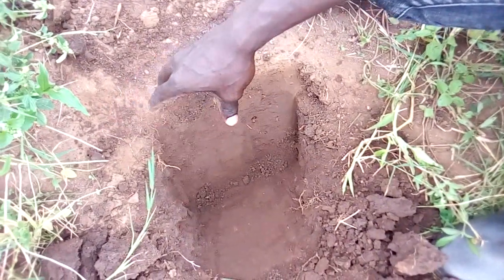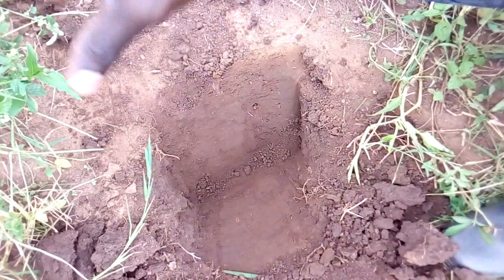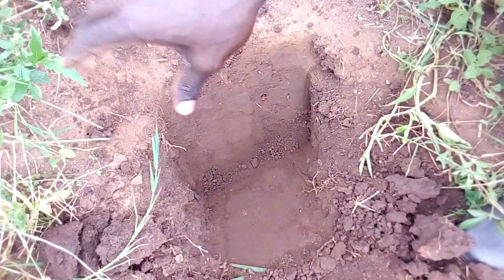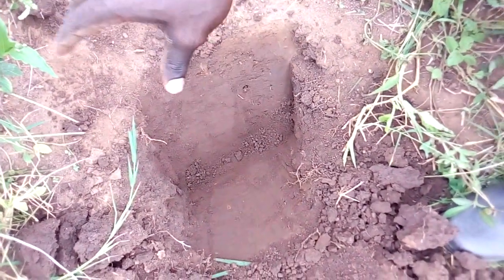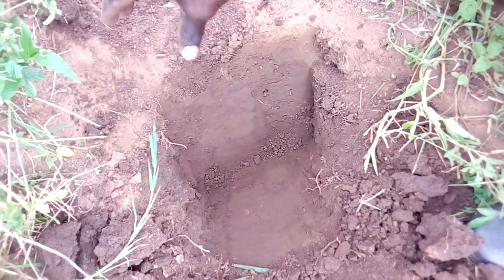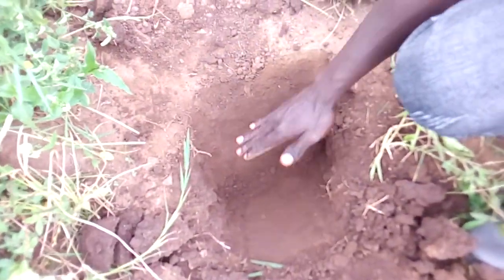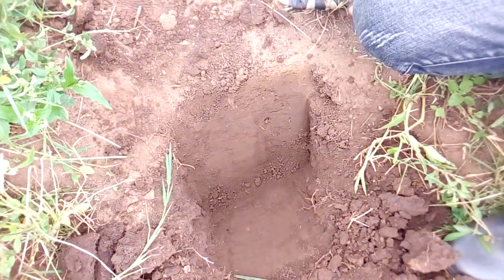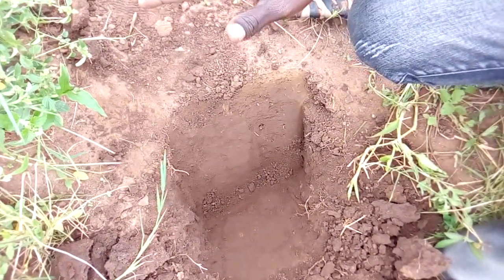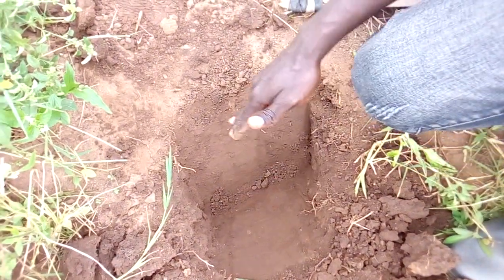The depth of the cut that you are going to make to collect your samples will depend on the purpose of the analysis that you are conducting. If you are collecting your samples on land that is going to be used to plant annual crops, or usually shallow-rooted crops, you can collect your samples from a depth of around 0 to 15 centimeters. But if you are planting usually perennial or slightly deep-rooted crops, it can be from a range of 0 to about 30 centimeters or even deeper.